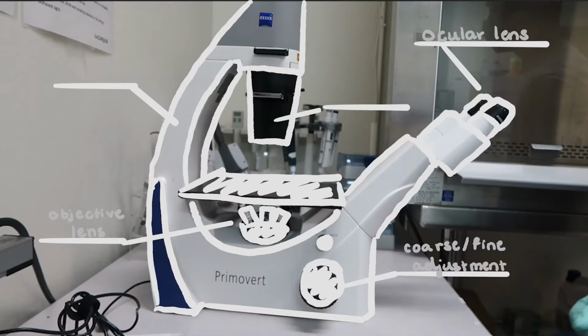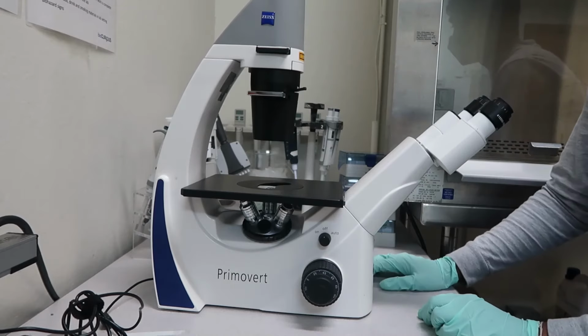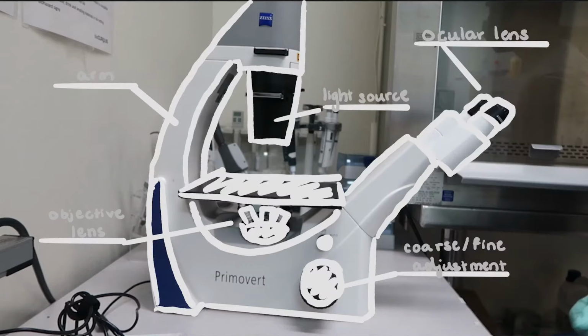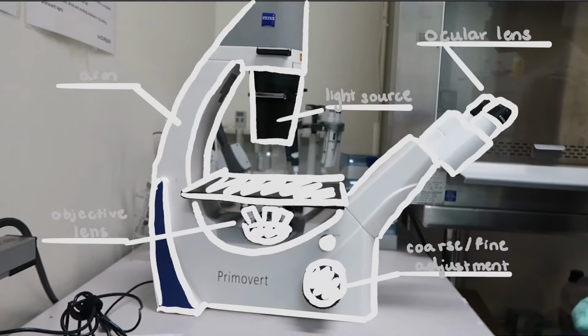Now, in addition to these parts of the microscope, we have the arm, which either holds the objective or the light source. In this case, it is holding the light source. And this light source either shines down or up to the sample, brightening it so we have a clear view of what we want to look at.